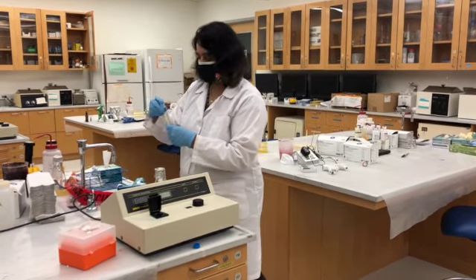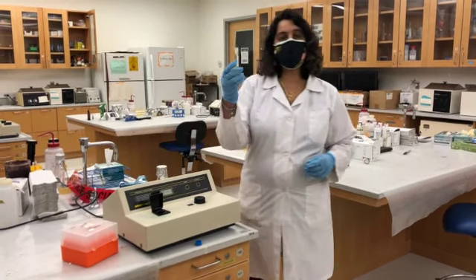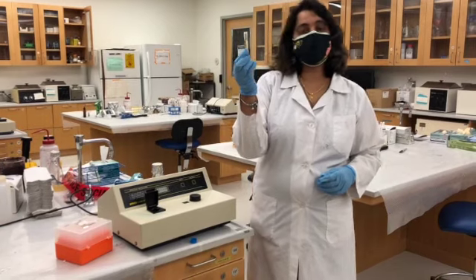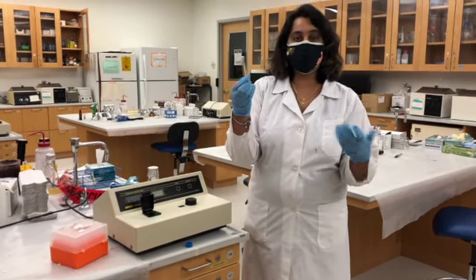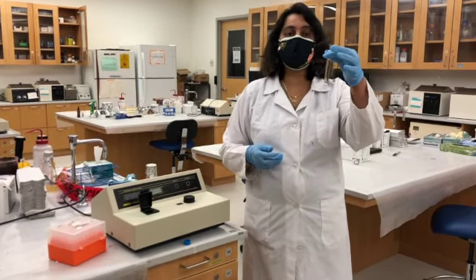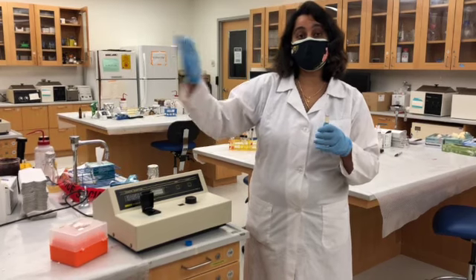Now I do have two cuvettes. One cuvette is taken, this has a sample for the 60-minute growth of the bacteria. So I grew the bacteria for approximately an hour and I took the sample, so we can track the growth of the bacteria over the time.